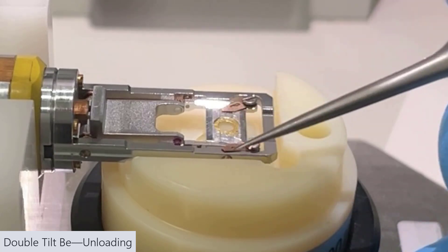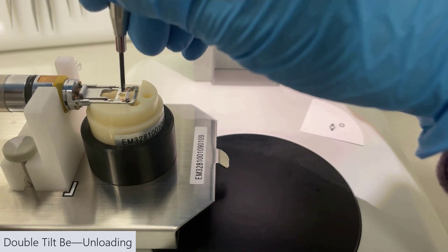Now, move the little flaps back in place. Make sure they're seated properly and then close the screws.